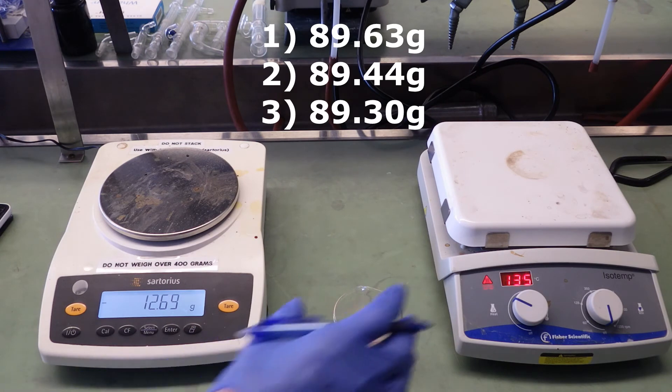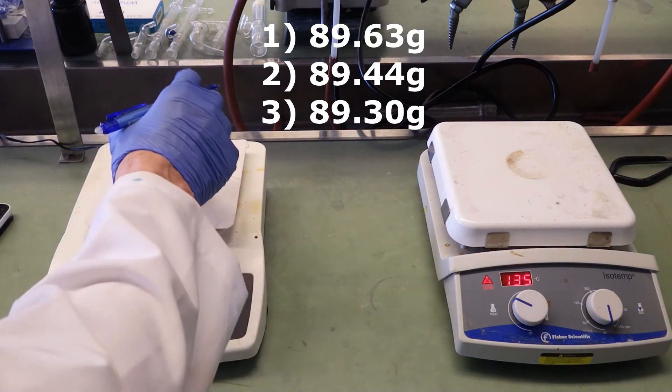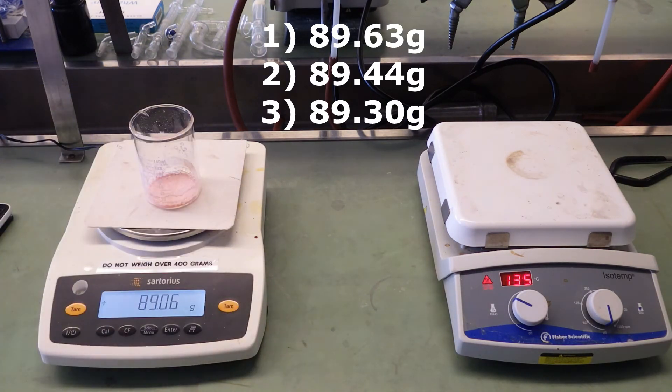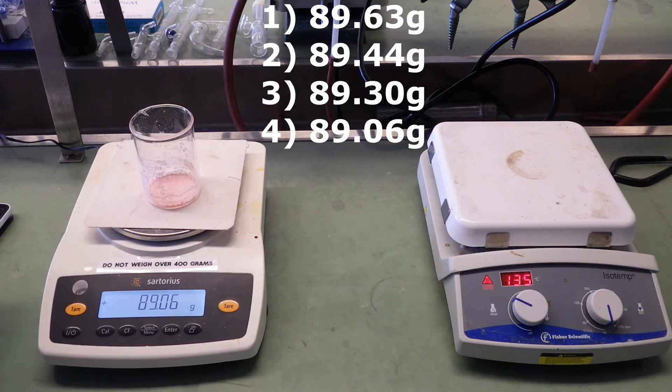Now I've heated this quite a long time before I take this final and fourth reading. This is 89.06 grams. So we have our data. Let's go back to the lab procedure and look at the calculations.